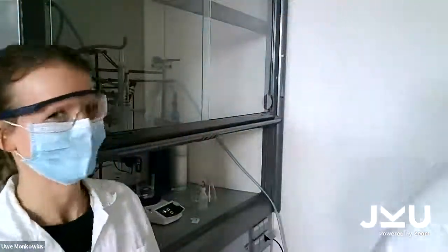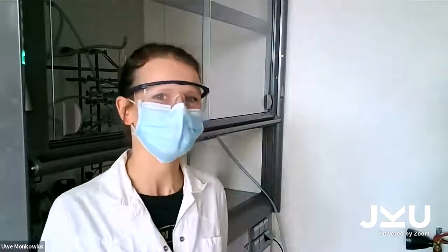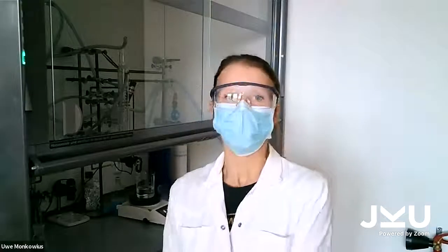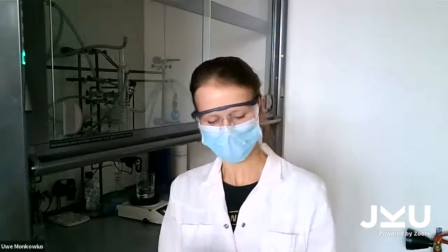Whoa! It gets bigger with time. Yeah. Today we do a lot of dangerous things because our boss isn't here. But to be on the safe side, I will wear gloves. We want to show you chemical patterns by an oscillating reaction called the Belousov-Zhabotinsky reaction.